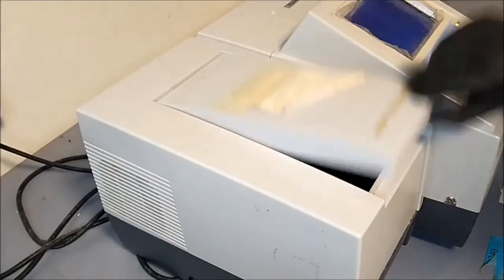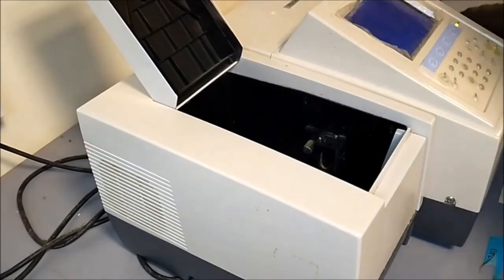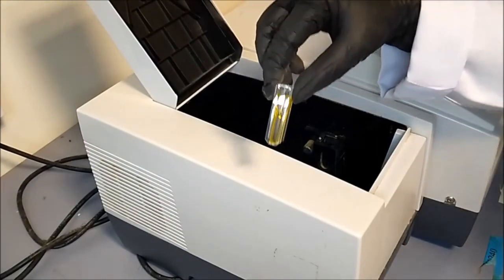Sample from test tube 6 will be used as the blank to eliminate background readings.